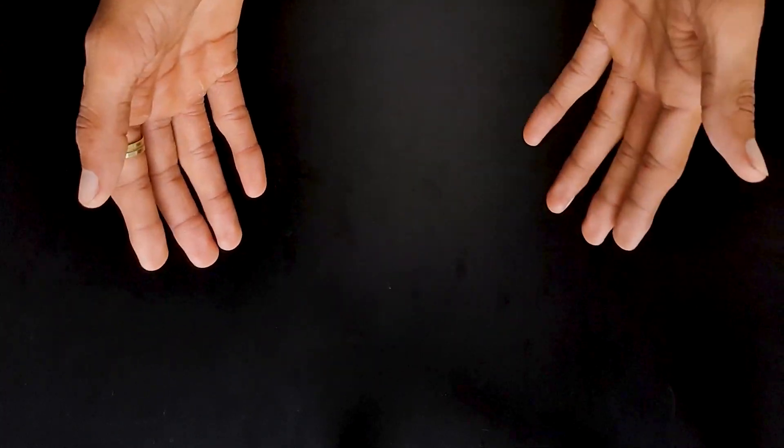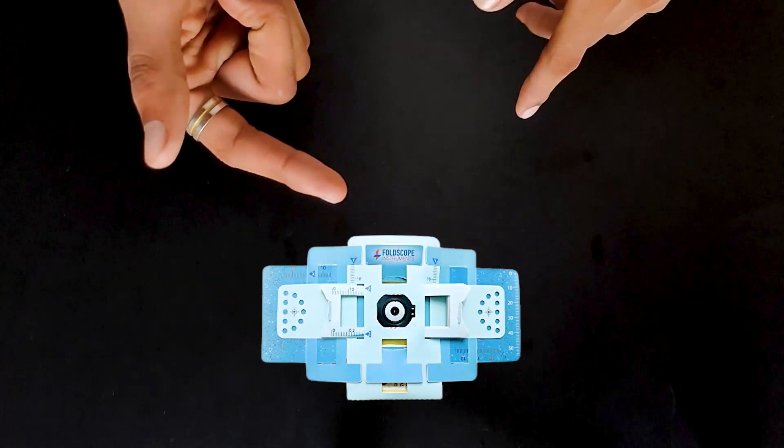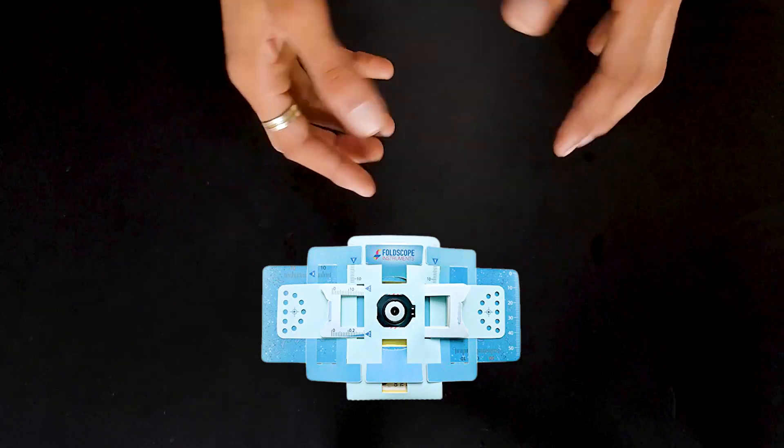Which microscope are we using? The fold scope which I have already shown, which is this. And we will use this microscope and we will explore the body parts, so let's try to do it.